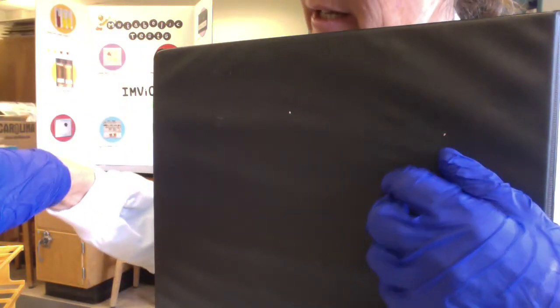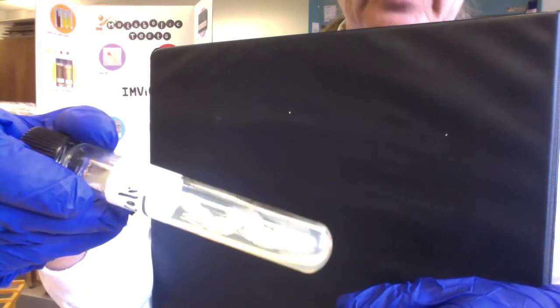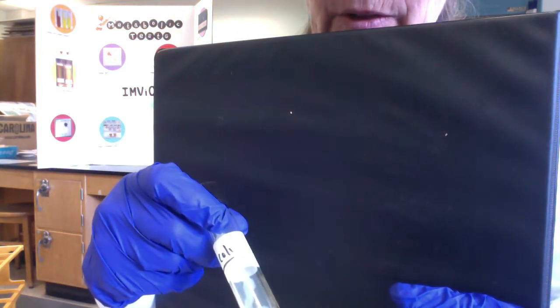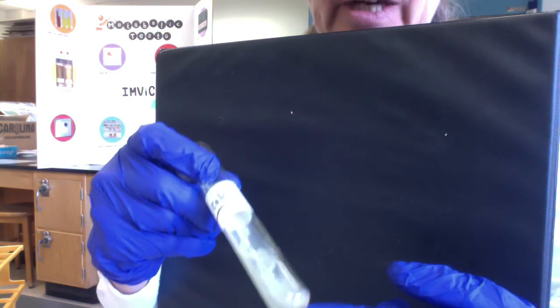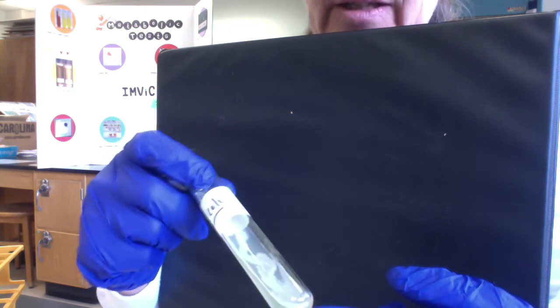And then, folks, this last one was an E. coli, and we just did a regular transfer to a regular agar slant. And you recall we transferred the bacteria to the surface of the slant. And here we can see they're growing very happy. I don't think you can see because I'm not doing a good job here, but I can see that we've got really good growth. The growth where the cells are growing is in that nice S-shaped pattern. Remember, we kind of slithered our loop up the slant. Okay, so we had good growth with the E. coli as well.